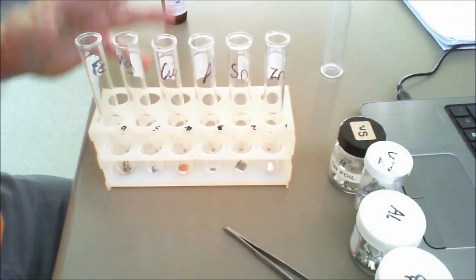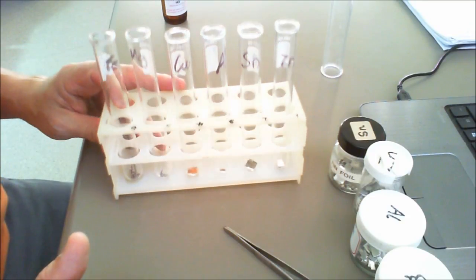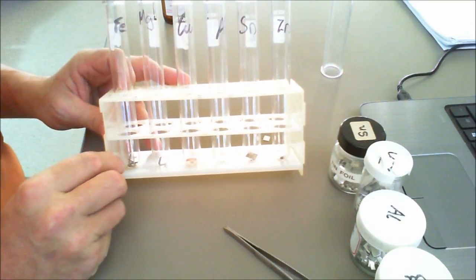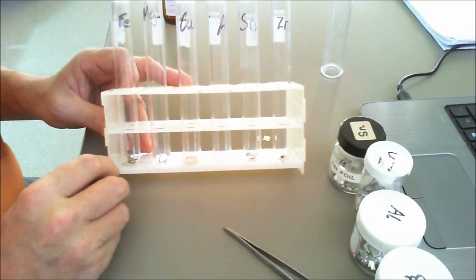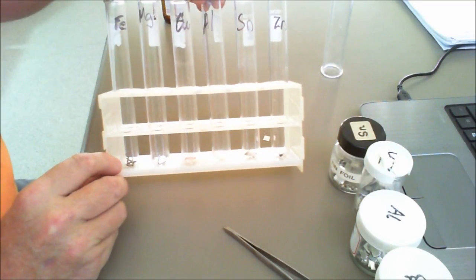Okay, now I've just changed the angle slightly so it's a little bit easier to see here. What we have is six common metals that we use within the laboratory, and we have a sample of each of them down in there.